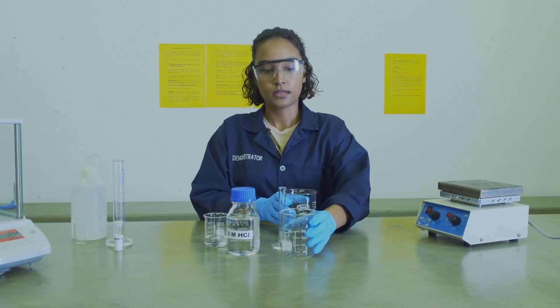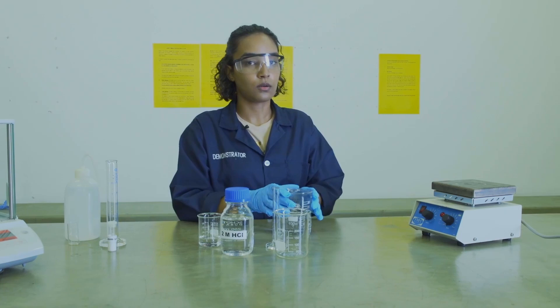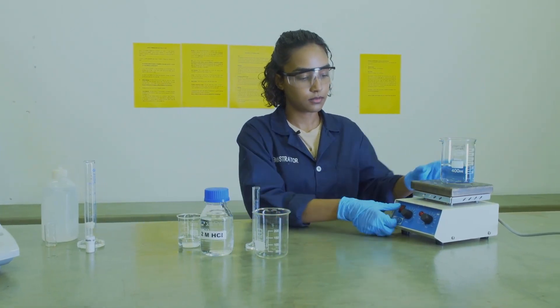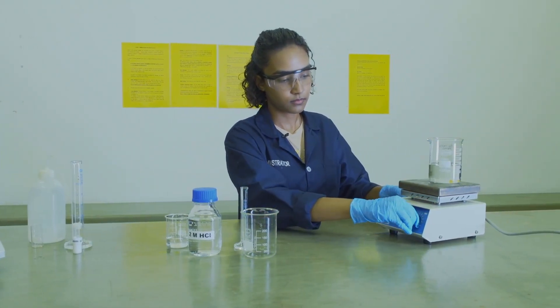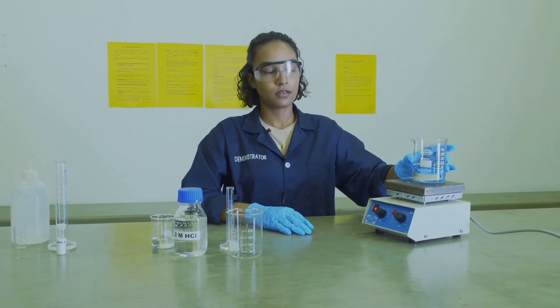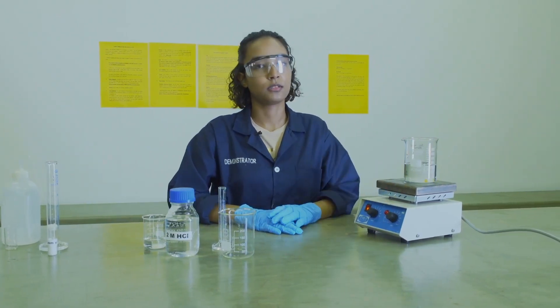Once this is done, we can then place it on a hot plate and heat it until near boiling. Please note that everything in this experiment must be performed in duplicate.